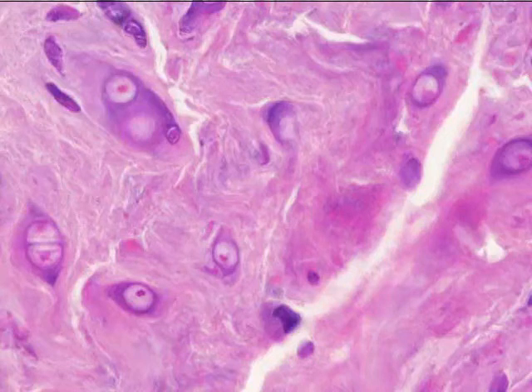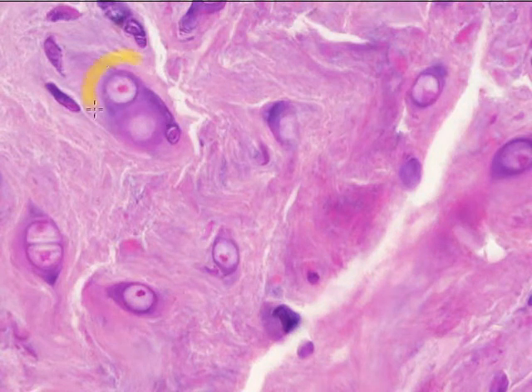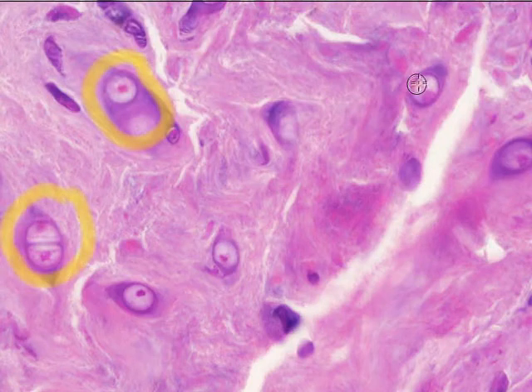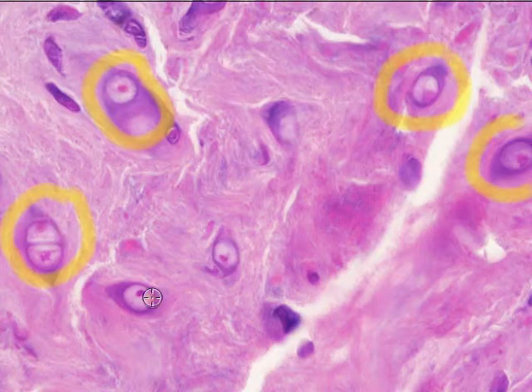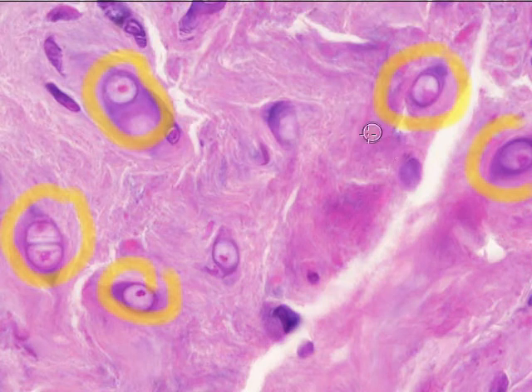What we see here is a very far dispersed set of chondrocytes, where the cartilage cells have a lot of space between them. They have a lot of matrix between them. That's one of the big search images to look for. There in their lacunae, we can see some of the white regions there that are helping to support the chondrocyte cells. But look at the matrix.